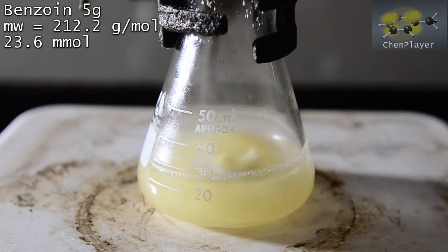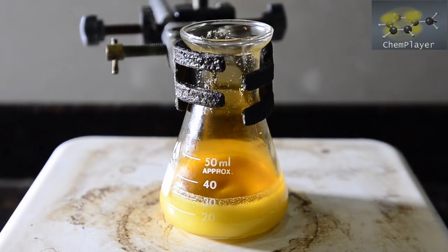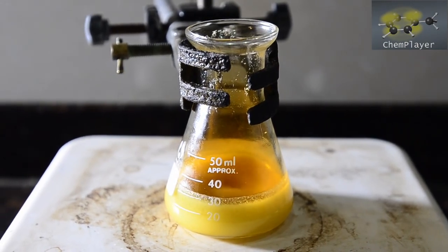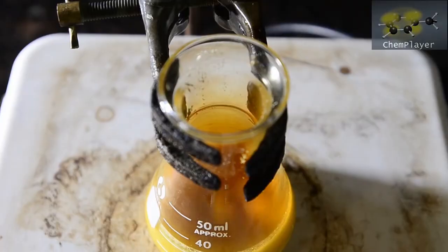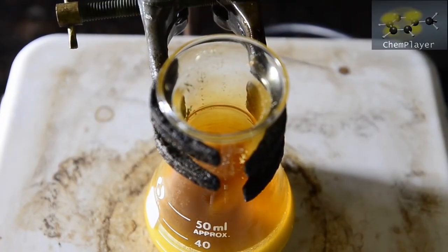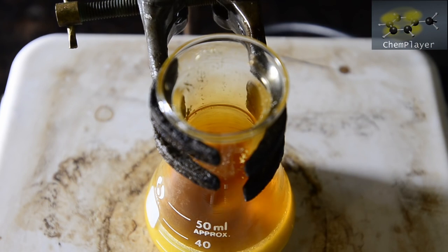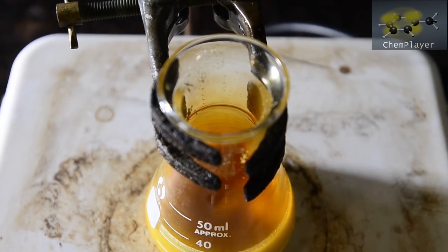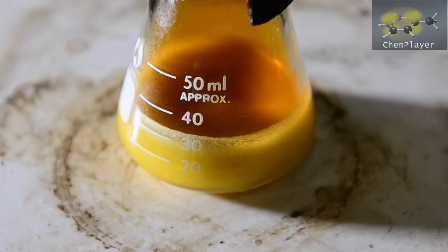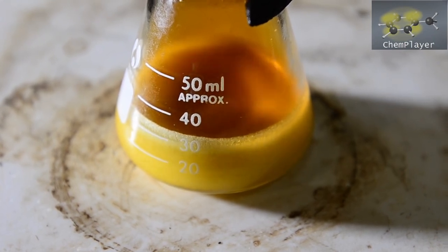Towards the end of the addition, even without heating, you should see some brown fumes appearing in the flask. This is nitrogen dioxide being formed as a byproduct of the nitric acid doing its oxidizing job. It's highly toxic and has a lovely delay action, killing you of respiratory failure potentially several days after exposure. So right about now you want to switch on your ventilation.